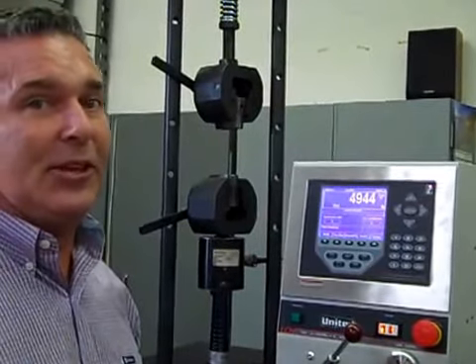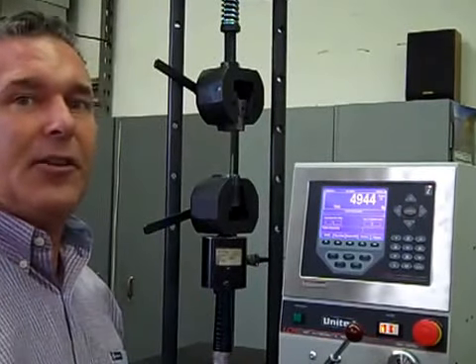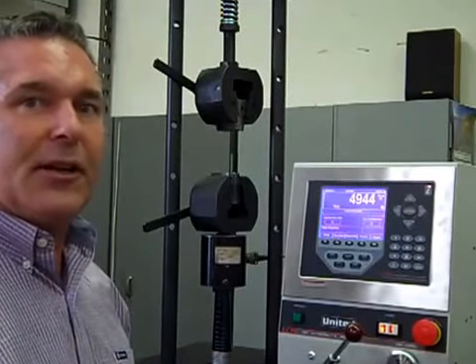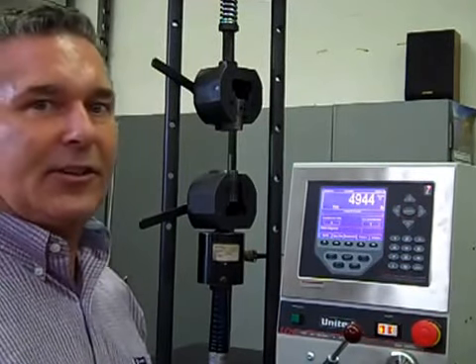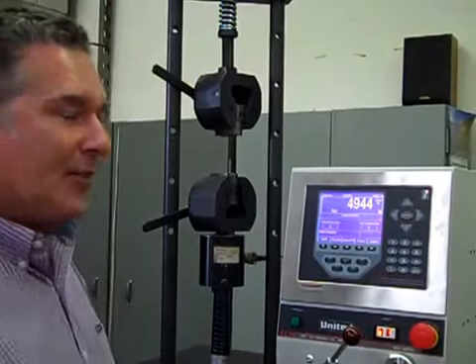And that's how easy it is to use this machine. It's a very simple, hydraulic, manually controlled test machine. The United LCH Series Speedy Tester. Thank you very much.